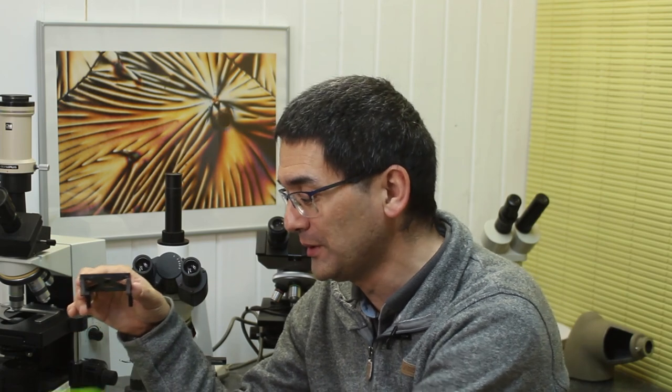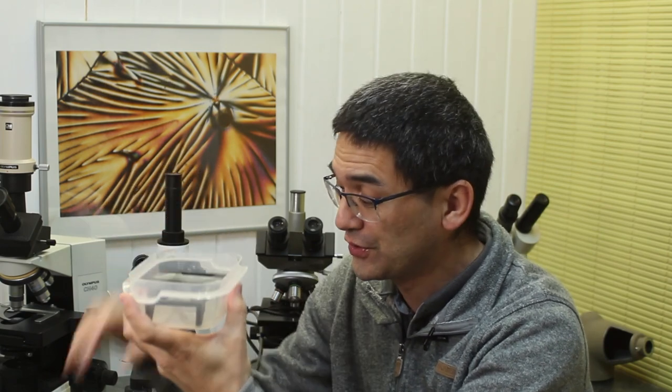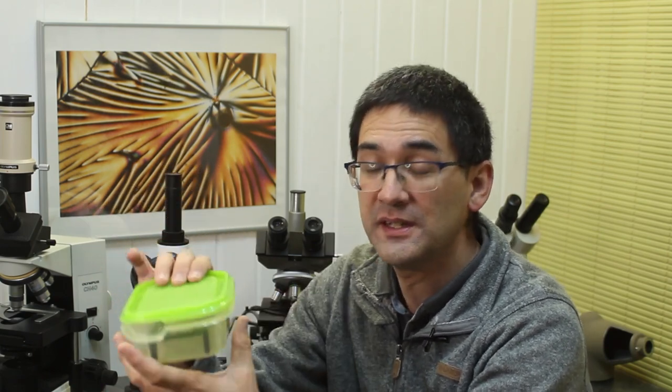So what I've done today, and this is basically what I wanted to show you as a little suggestion, is you can make yourself a little rack like this here. In this case, I have 3D printed it, but of course you can use pretty much any system that you want. What I'm going to do is I'm going to put this rack now into the lunchbox. These microscope slides, I don't know if you're able to see this here, I put them on the rack like this, and then on the bottom here I have water. Yeah, and then of course the lid goes on top, and with this setup I'm able to store the slides for a very long time.